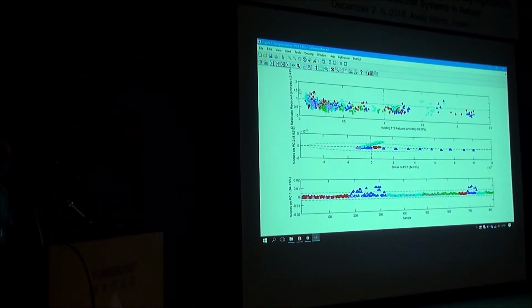So you can find the outliers by looking at Hotelling versus residual plots. How do you find the outliers? Yeah, they will stand out. If you look at the residuals versus Hotelling, normally outliers come here. So there's always a cleanup step before doing any data analysis.